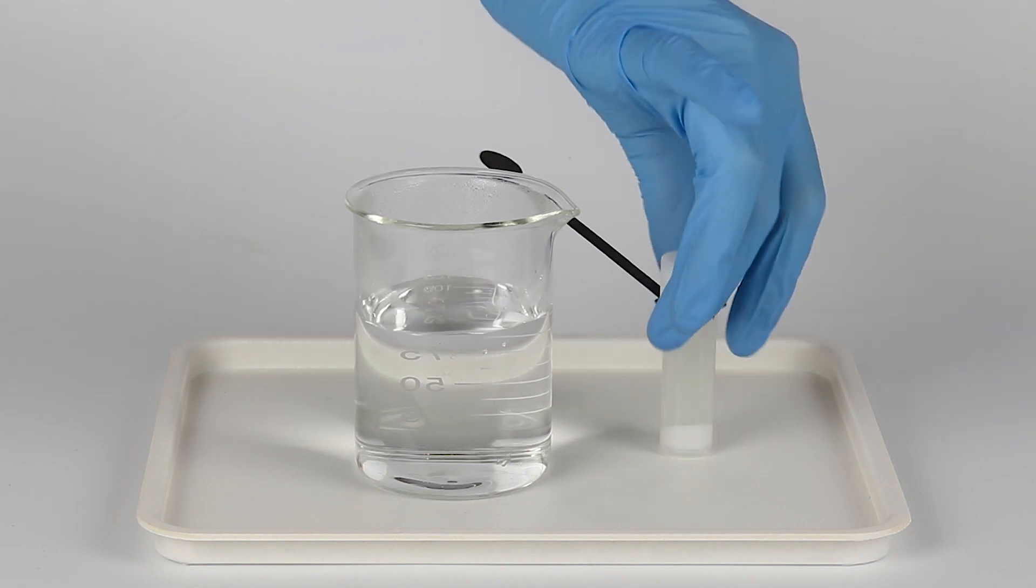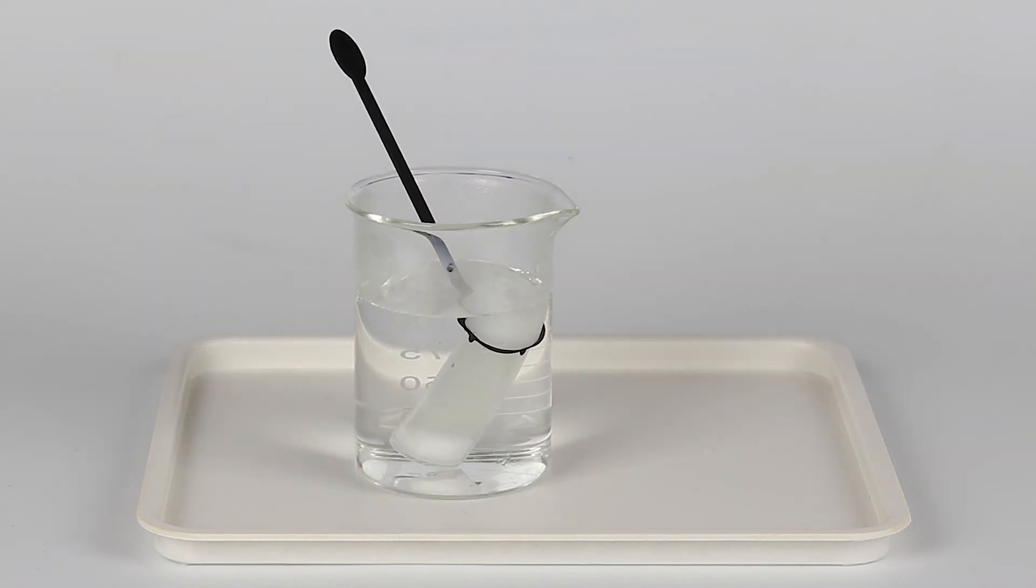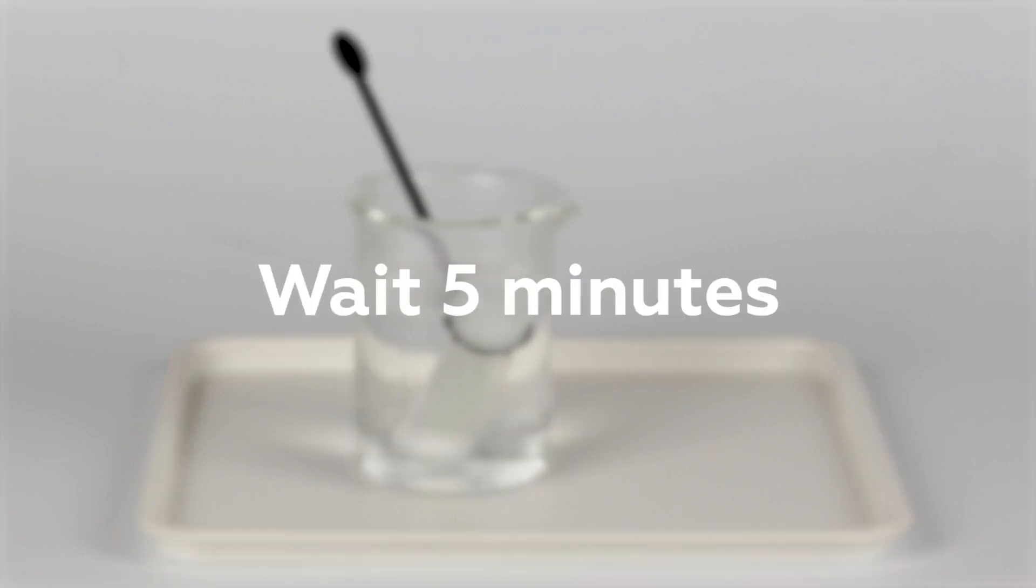Fill the beaker approximately three-quarters of the way with hot water. Then put the two items together into the beaker. Wait for five minutes.